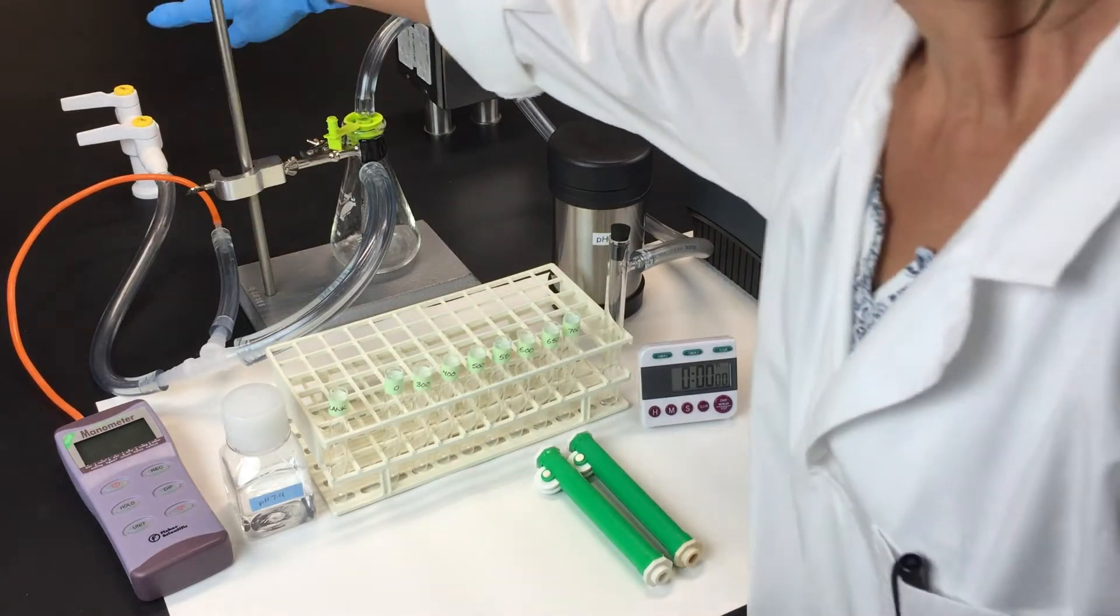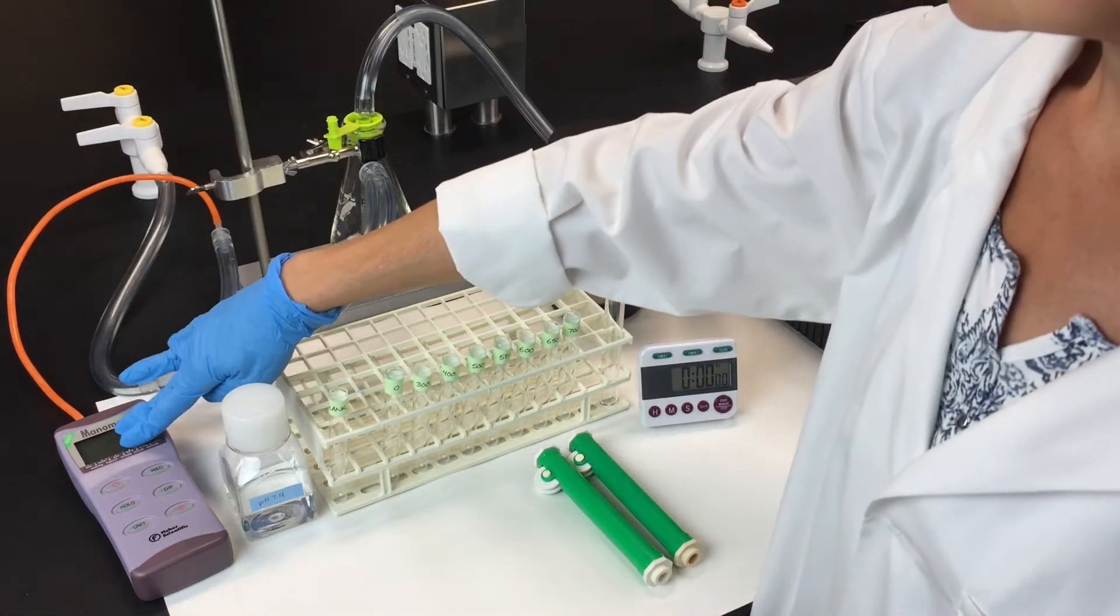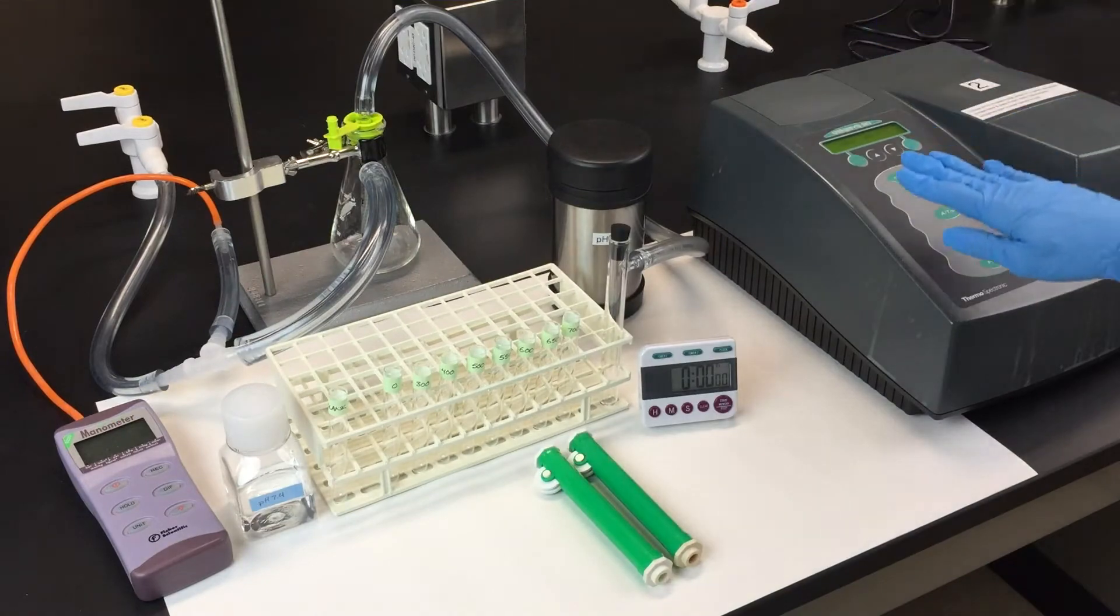We'll be using a vacuum system, a manometer, and a spectrophotometer.